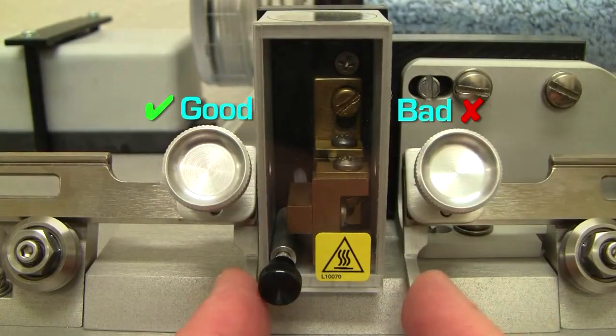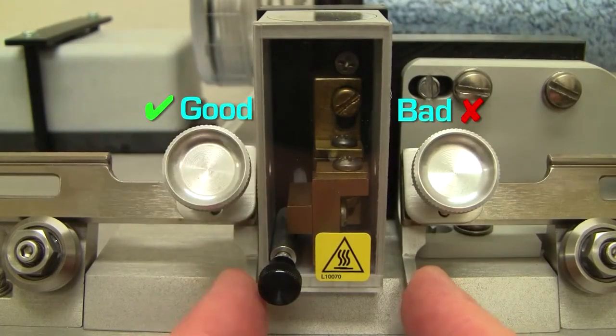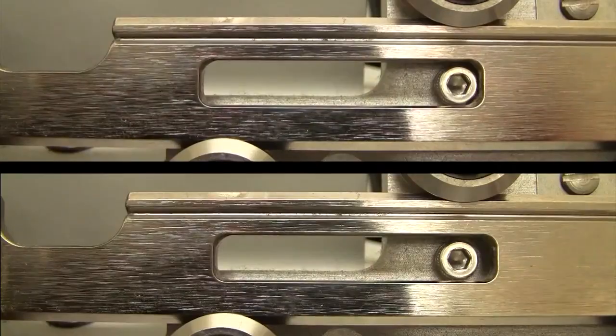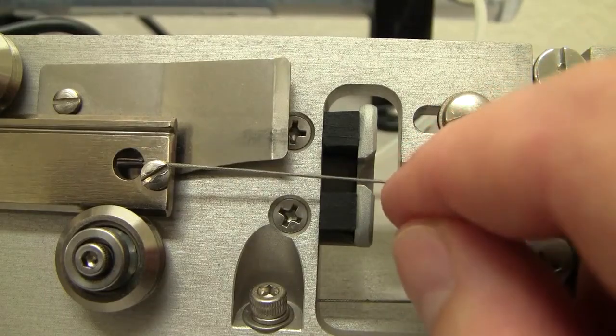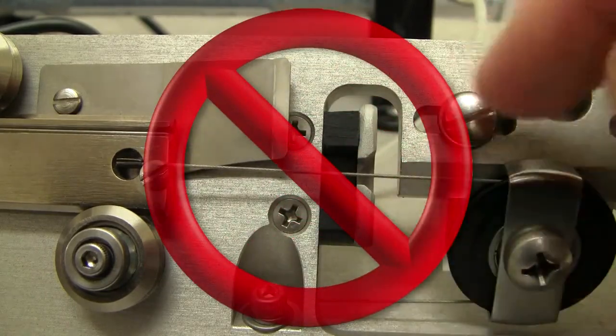Under no circumstances at all must the pull cables be under tension. If you cannot pull the puller bars together until they sit against the hex screw in the slotted hole, ouch! Call Sutter Tech Support immediately. If the pull cable is tuned to treble C, or any other note for that matter, it's under tension and it shall not be.